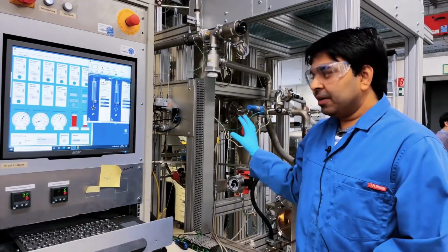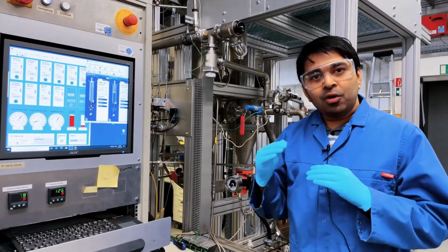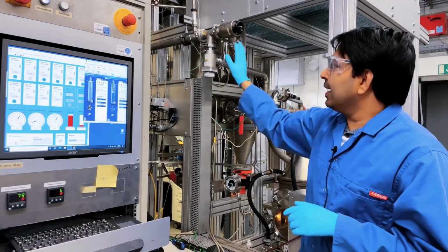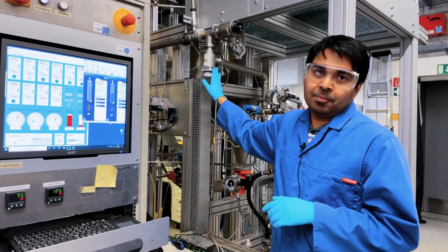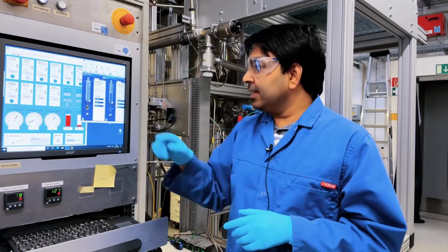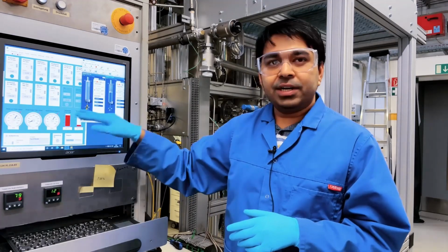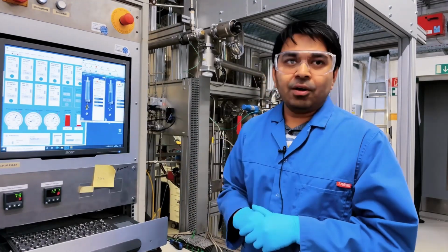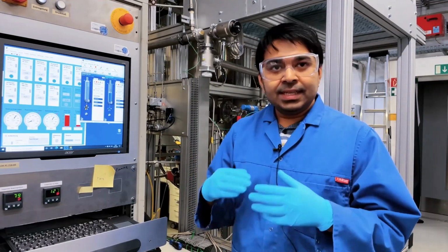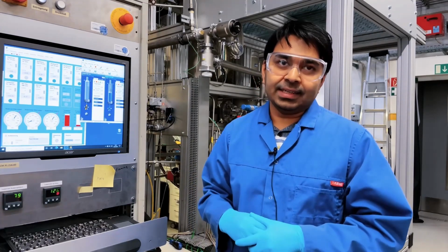As you can guess, this spray flame reactor is a closed system, and generally we operate at a little bit low atmospheric pressure, and we have pressure sensors, temperature sensors, and to regulate the pressure we have the pump system, which is connected to a bigger pump. And from here you can see that this is a very well-defined system. You can control the gas flows as well as monitor the temperatures. And this is a system where we also can control the rate of precursor feeding into the reactor. With this lot of parameters, you can control which kind of materials you are going to get at the end.